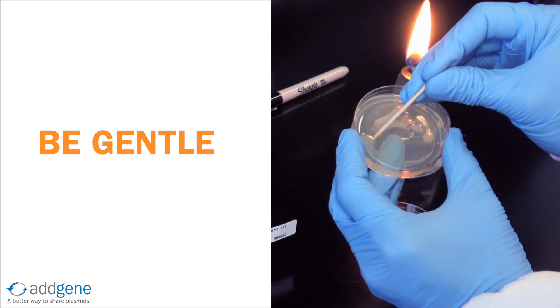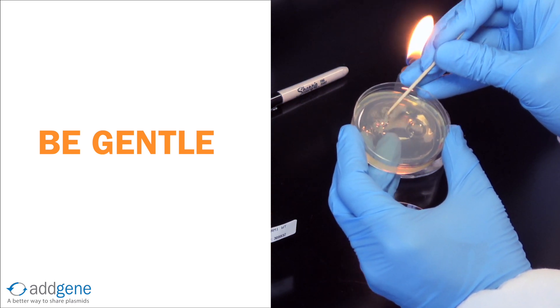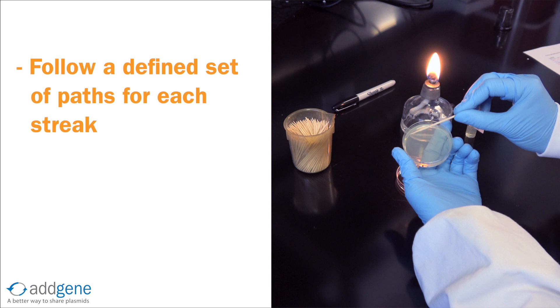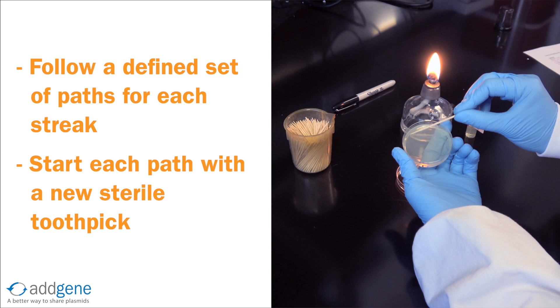Be sure to be very gentle and not to stab the plate with the toothpick, or you'll dig up some agar during the streaking process. We'll follow a defined set of paths for the streak, remembering to start each path with a new sterile toothpick.